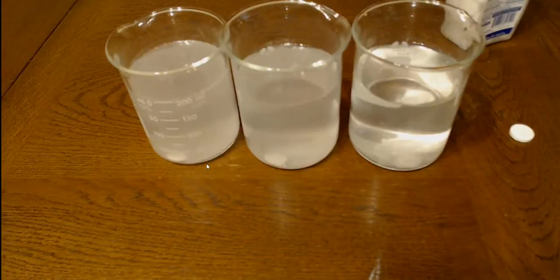So we're still bubbling pretty good over here. You can definitely see this one's smallest. That one's still going. And that's going. I'm going to pause the video and see if we can get a big size difference here. Okay, our high concentration one is getting so small that it's starting to get pushed around by the bubbles, and I'm worried it's going to just disappear pretty soon by wandering around.